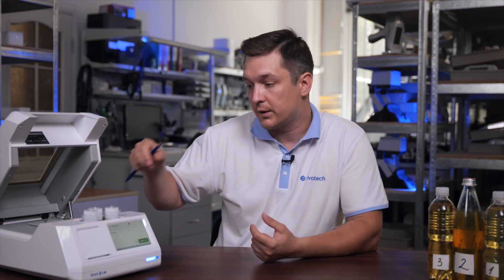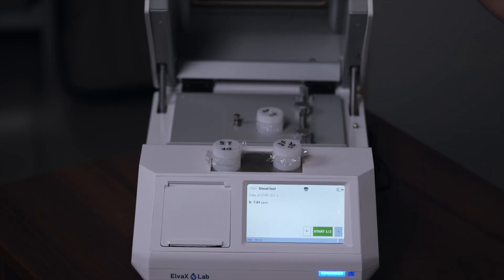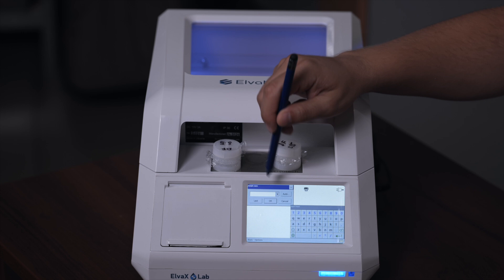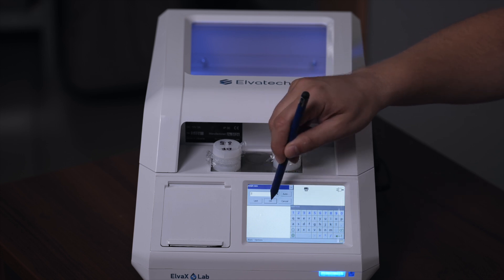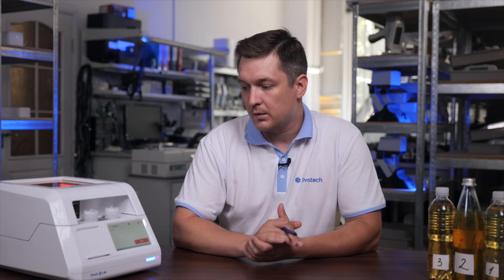Now we will measure the second and third samples, and at the end we will compare the results. I will place the second sample, name it 'second', and start the analysis.